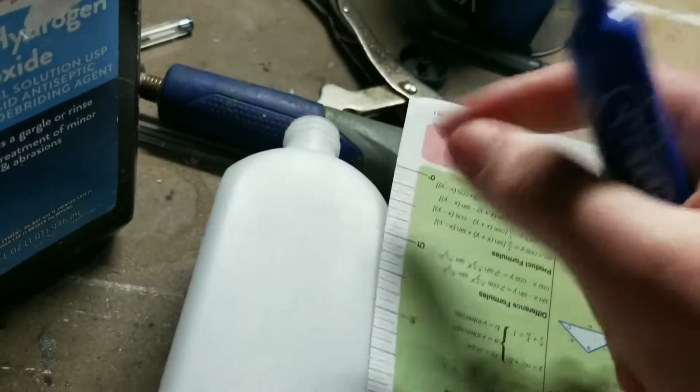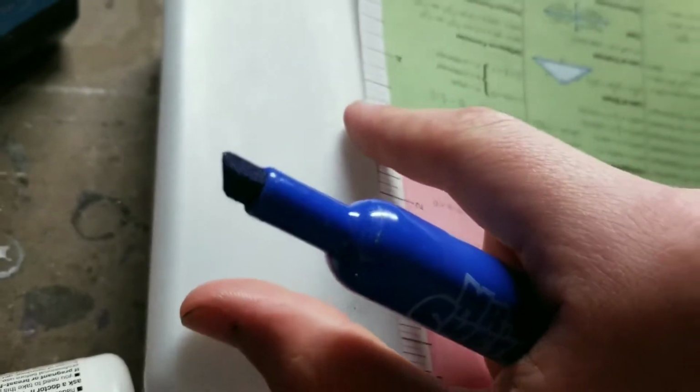So what you're going to do is take this bottle, and you're going to need a tape measure and a Sharpie marker. Okay, so I've got this crummy ruler that's made out of paper, but nonetheless, it's about 6 inches from bottom to top. So I'm going to get this perfectly aligned with the bottom, and draw a little dot about 3 inches from the bottom. And do the same to the other side.